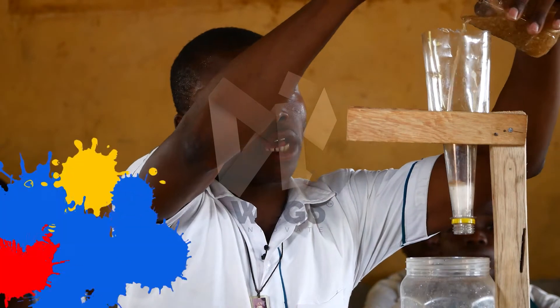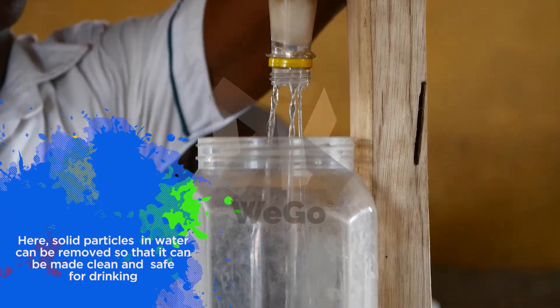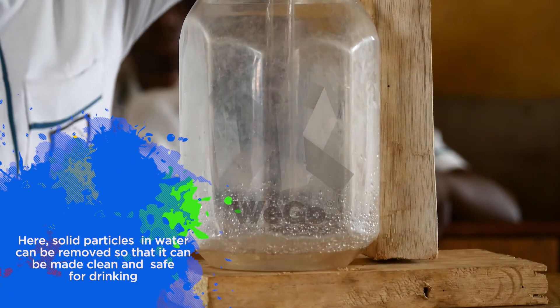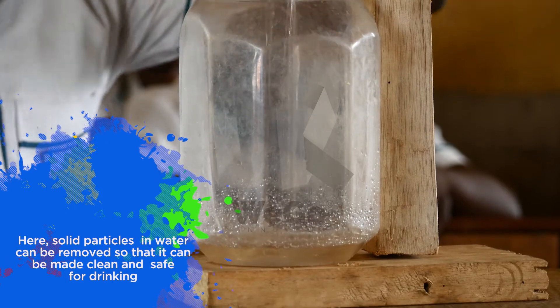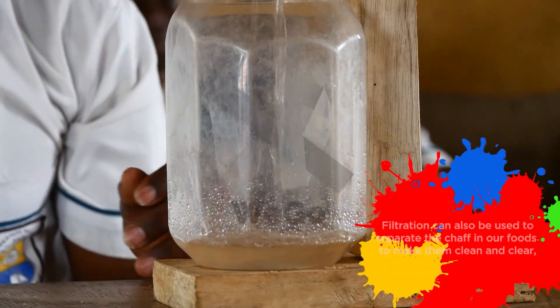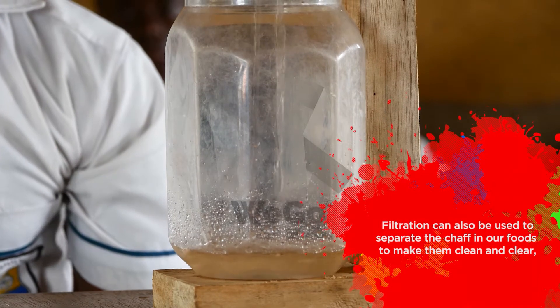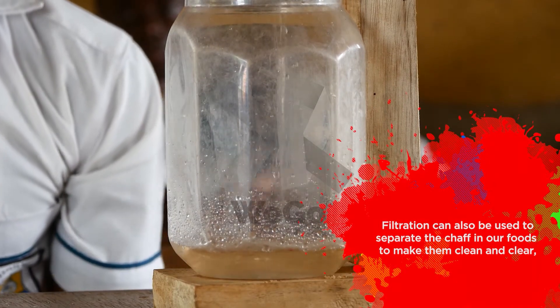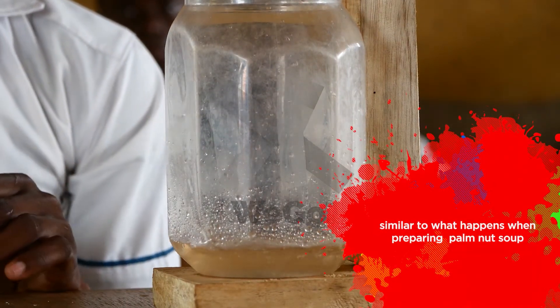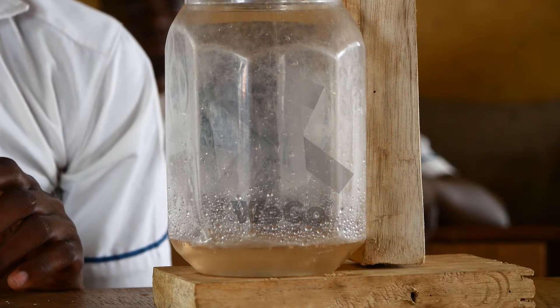Here, solid particles in water can be removed so that it can be made clean and safe for drinking. Filtration can also be used to separate the chaff in our foods to make them clean and clear, similar to what happens in cooking palm nut soup.